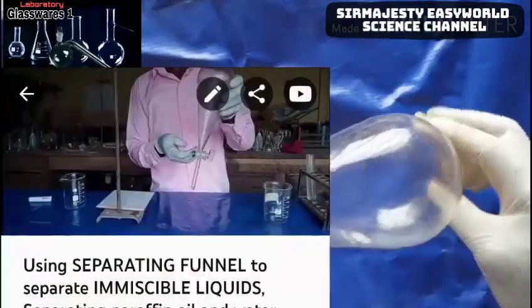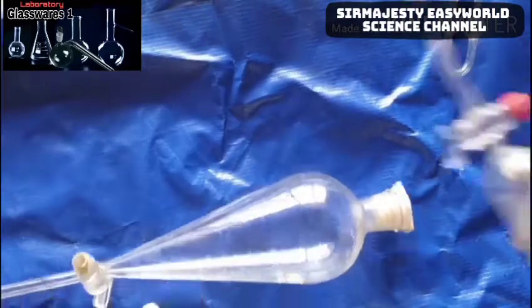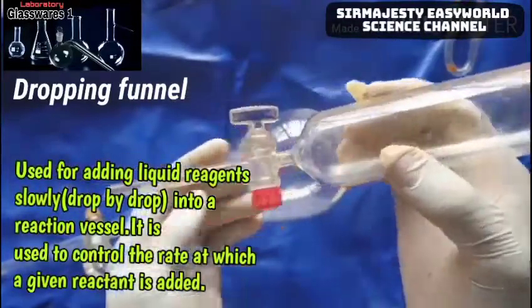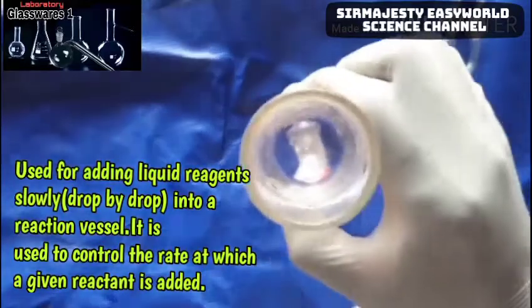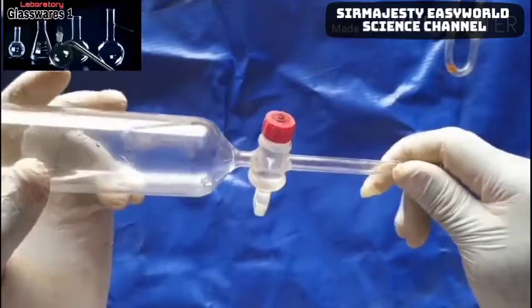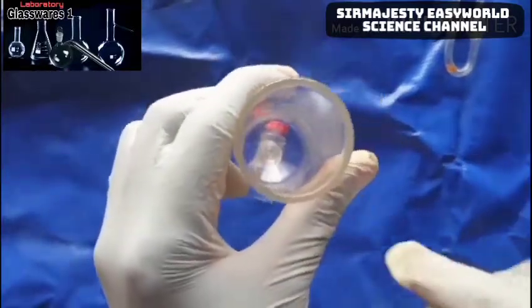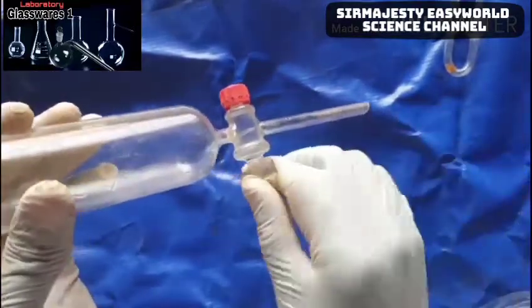Another funnel is the dropping funnel, used to introduce reactants gradually to a flask, especially in refluxing — like in the production of acetic acid. When you want the reactant to be dropping gradually into the reaction mixture, you use this dropping funnel. It has a tap, just like the separatory funnel.